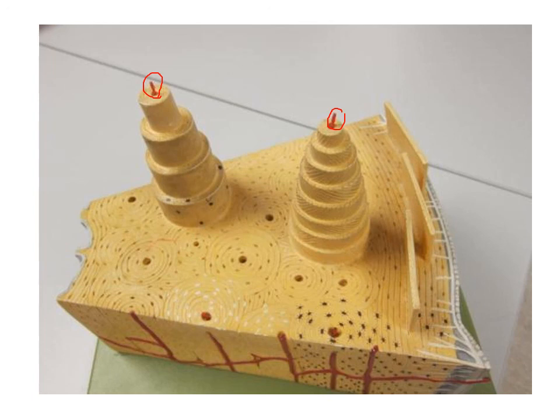They're divided up so you can see different ways that they're made. We're not worried about the different things, but this one in particular over here on the right shows how each lamella, in order to make it even stronger, has fibers that run at 90-degree angles from each other. And again, that increases the strength of what those osteons help provide. And again, you can see the osteocytes here. The rest of this model, pretty much everything outside of here, is pretty much hollow, and you can kind of see it. And so they're the lacunae.